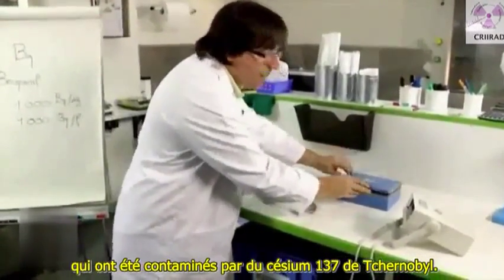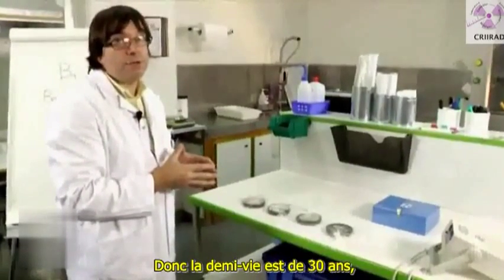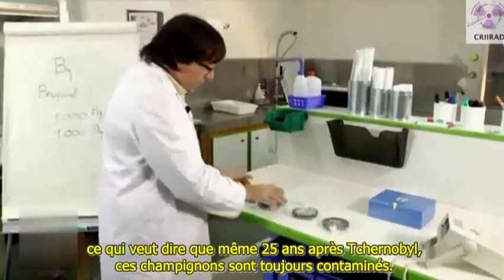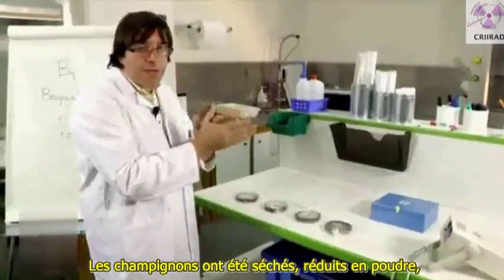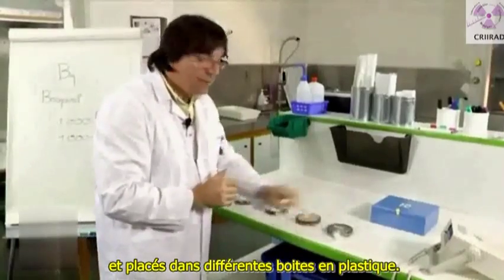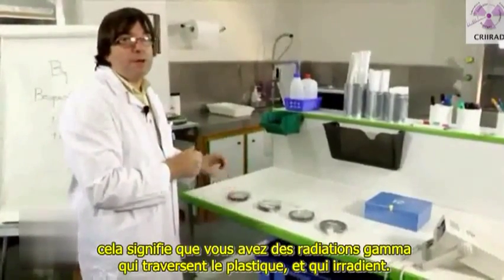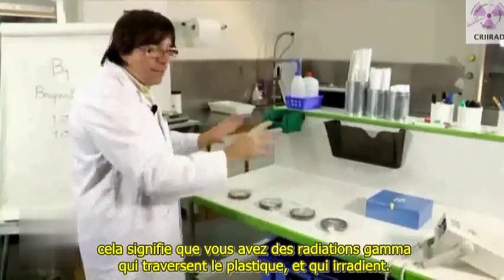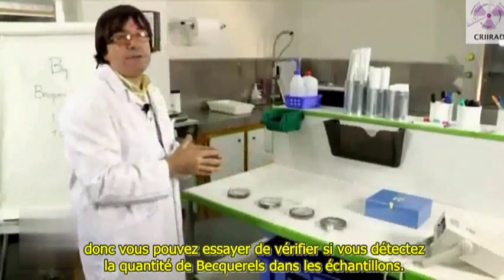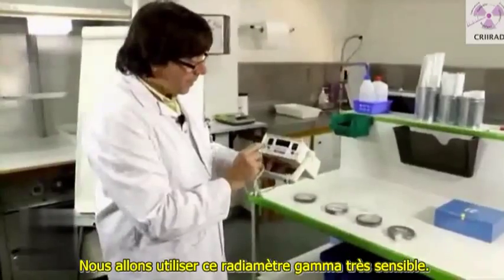So now we are going to check the contamination of mushrooms which have been contaminated by cesium-137 from Chernobyl. The half-life is 30 years, which means that even 25 years after Chernobyl, those mushrooms are still contaminated. The mushrooms have been dried, changed into a powder, and put into different plastic boxes. If you have Becquerel in the sample, it means gamma radiation is getting out of the plastic. We will use this very sensitive gamma meter.